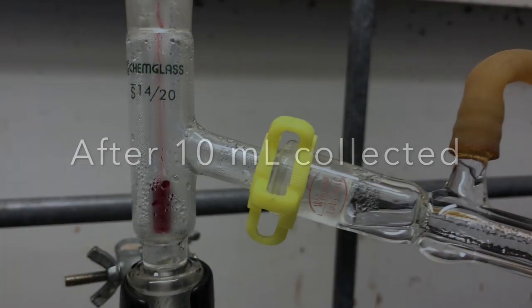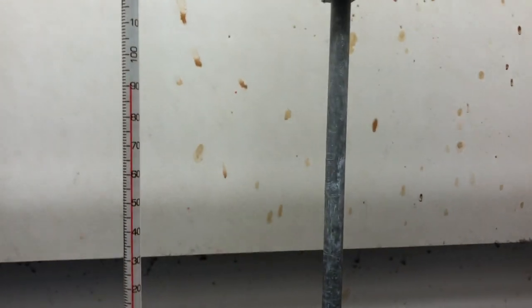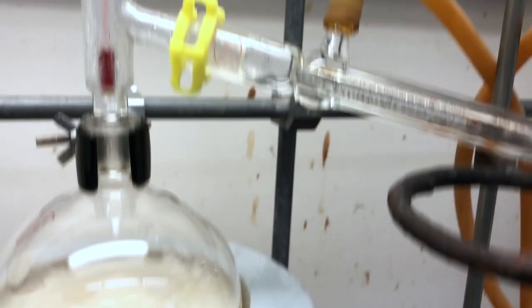Each time 10 milliliters is collected, we have to empty the graduated cylinder into a larger graduated cylinder.